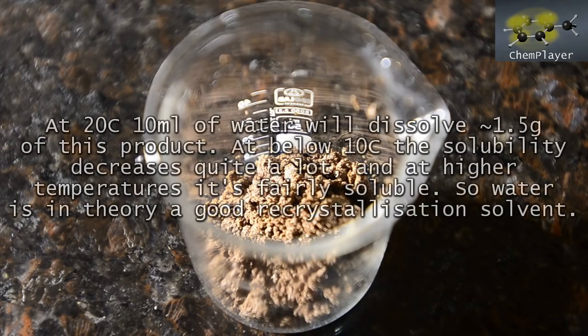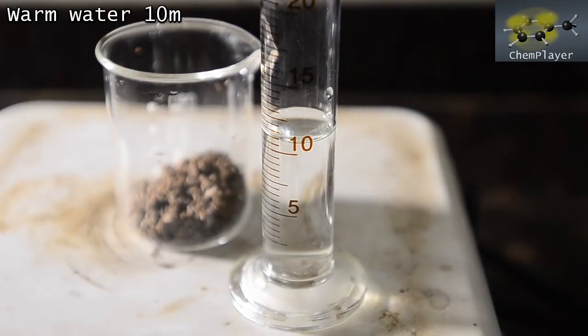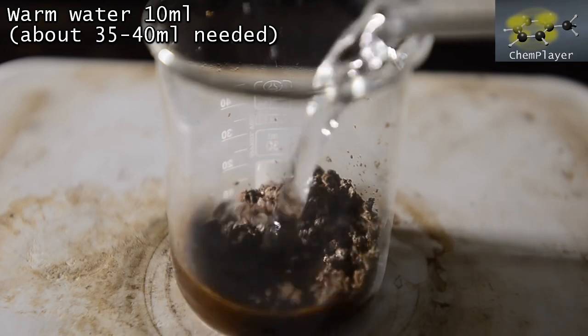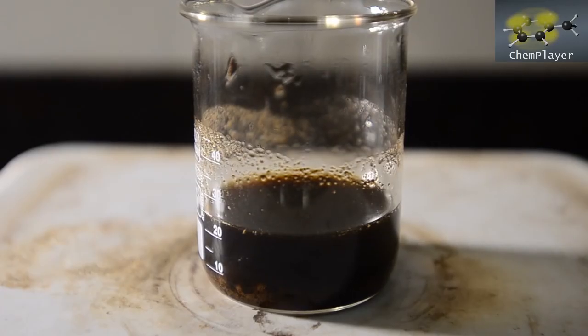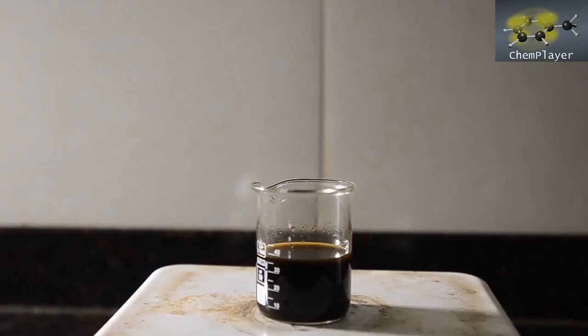The easiest way we can think of to purify is simply to recrystallize this from warm water, so let's give it a go. We've got the crude product in a beaker on a hot plate. We'll get a little warm water in here to start with, about 10 mils, and then see how we go. Added a little more water and now warming gently. Okay, we've got everything in solution using about 40 mils volume in total.